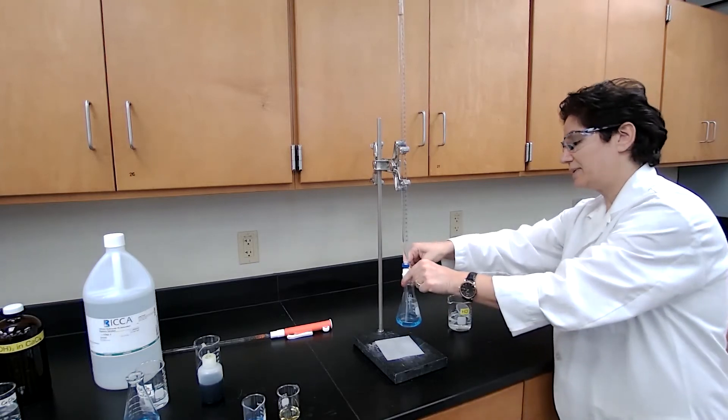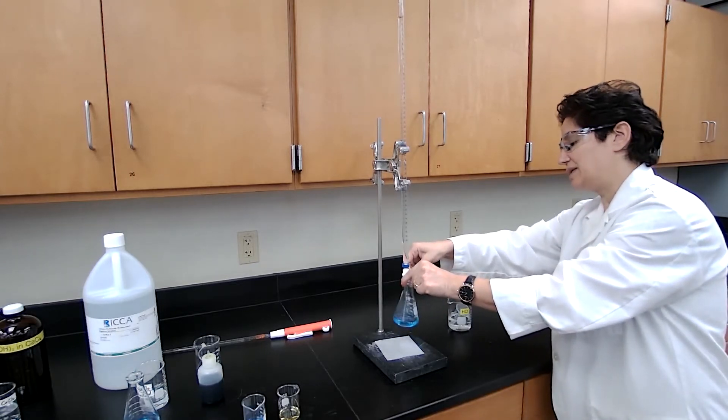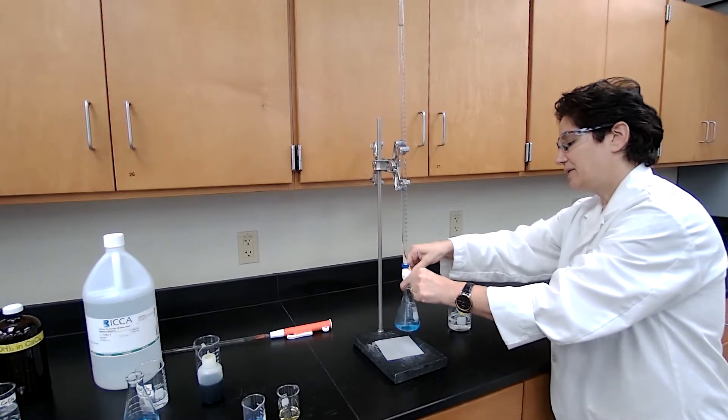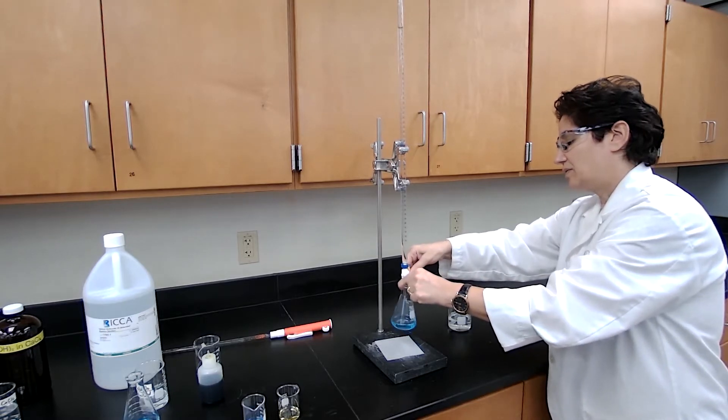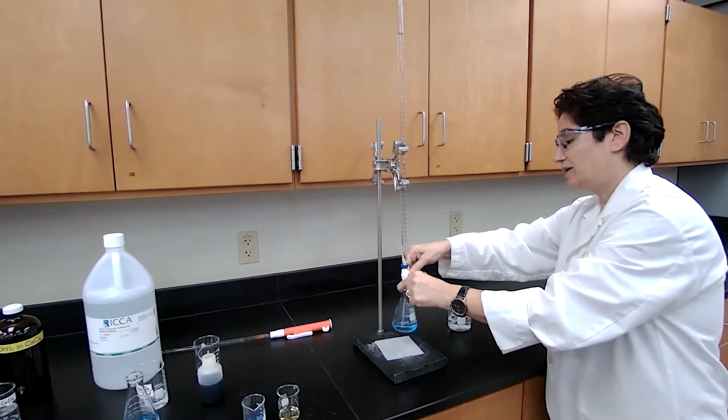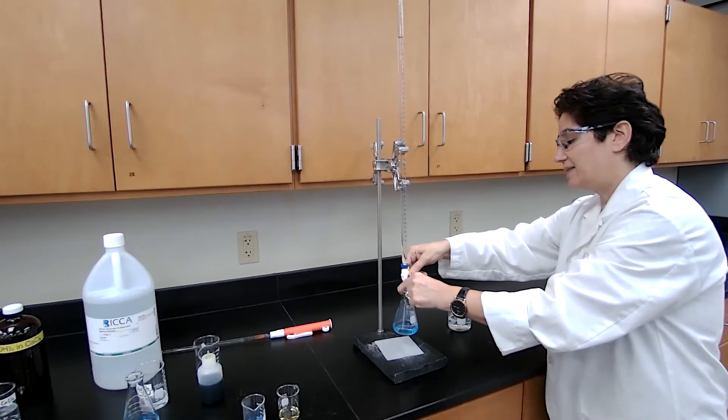I'm just holding my hand this way so you can see the color change that is happening here. So we are expecting the blue color to disappear and a yellow color to appear.